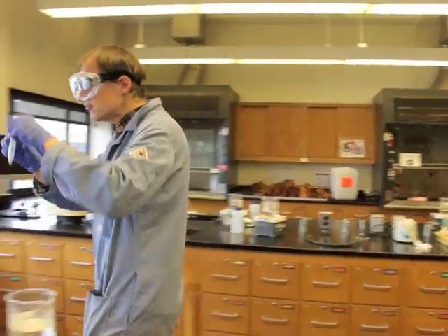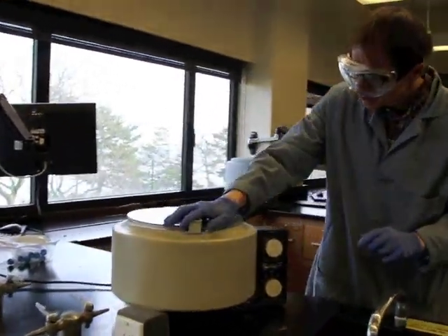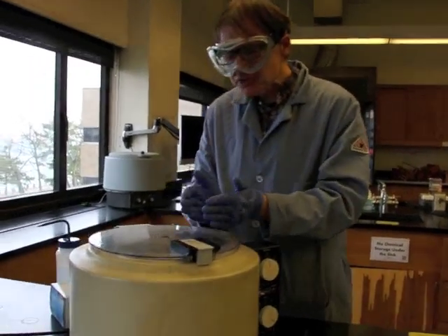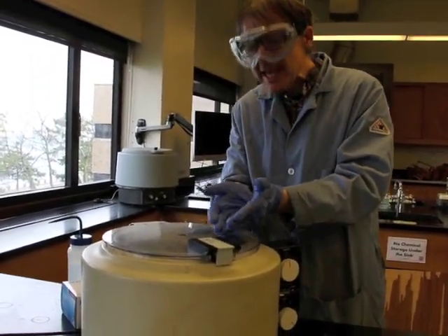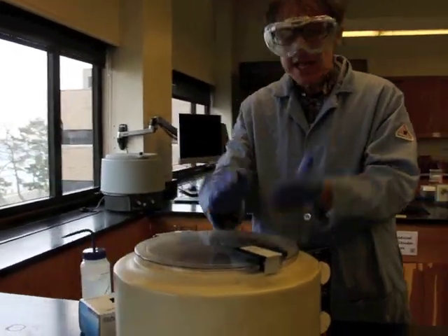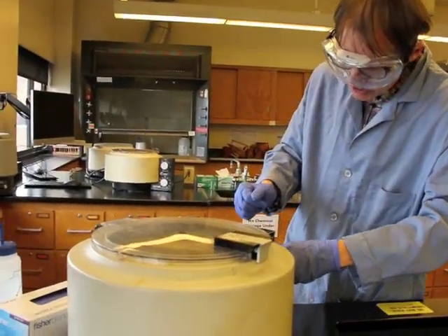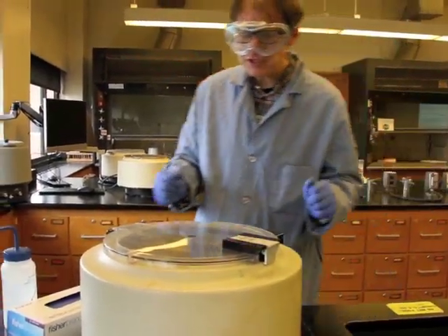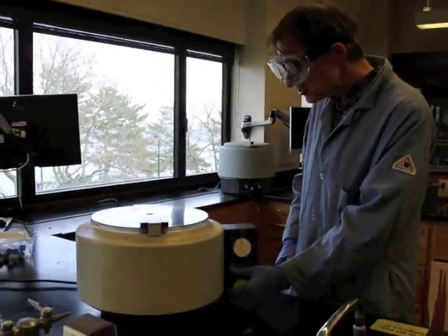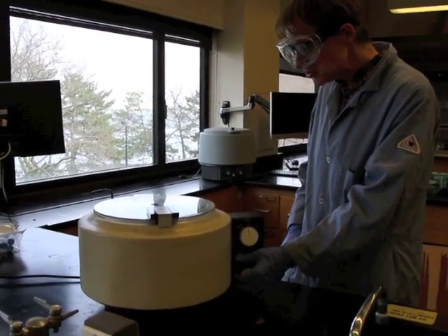So now I'll come back over here, and again put it on the opposite side, and we'll centrifuge again for 2 minutes. And in that centrifugation, we should be separating any contaminants, any copper or silver ions into the supernatant, and then the bismuth hydroxide will stay down at the bottom. So 2 minutes of centrifugation. Okay, so now we've done the centrifugation for a couple of minutes. I'm going to hit the brake here. We'll stop this and we'll see what happened.